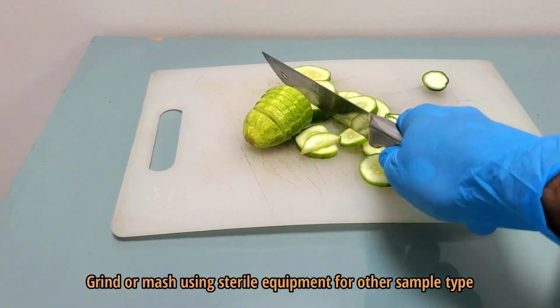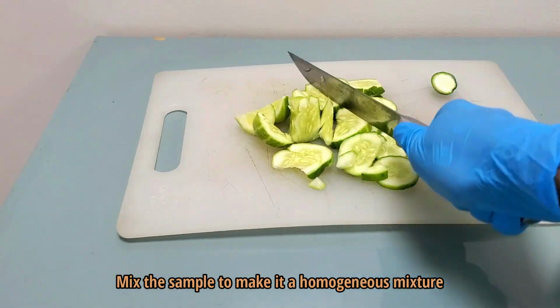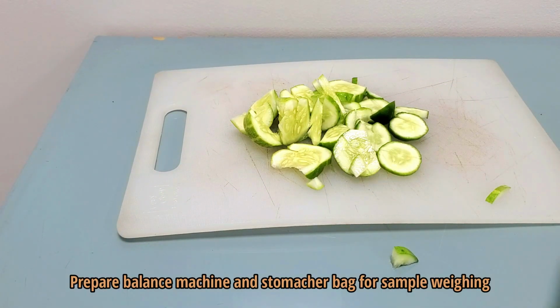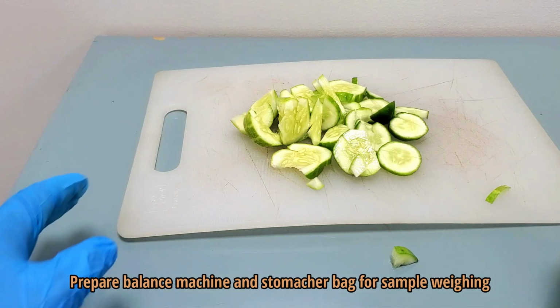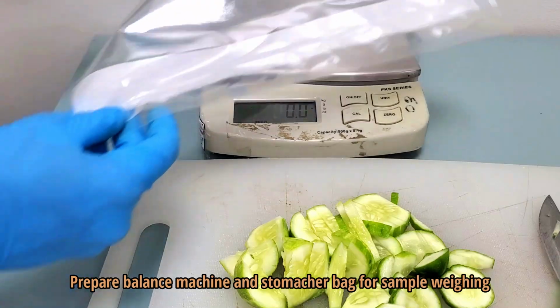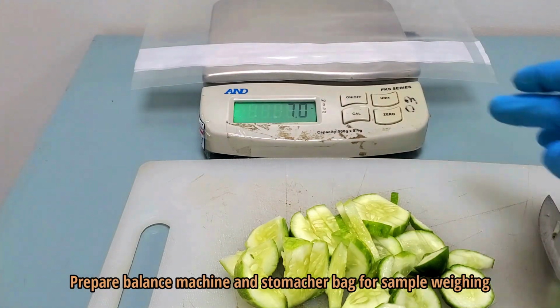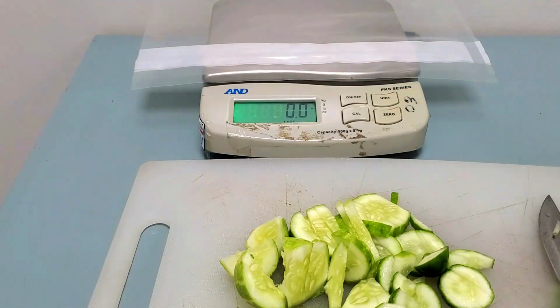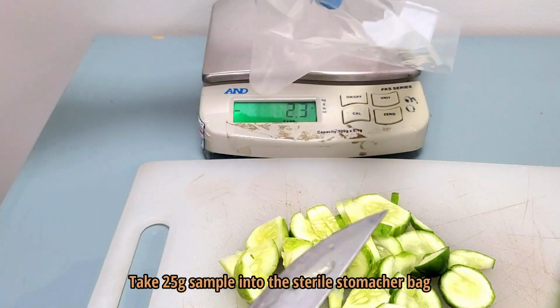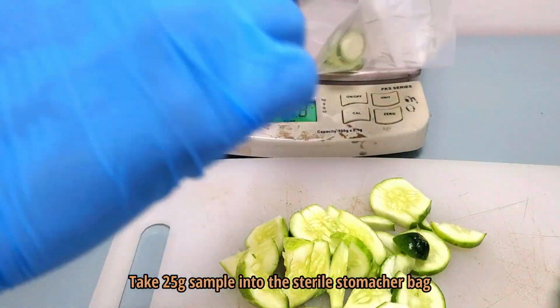Grind or mash using sterile equipment for other sample types. Mix the sample to make it a homogeneous mixture. Take 25 g sample into a stomacher bag.